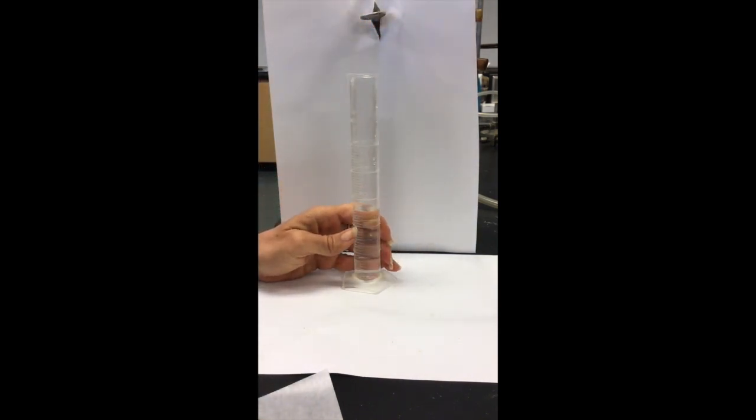When I read this, it's between 25 and 26 ml, so I'm going to estimate a decimal place. I'm going to call that 25.8 milliliters. You want to record the initial volume exactly. Your procedure says about 25 ml, but you need to record that exact volume.